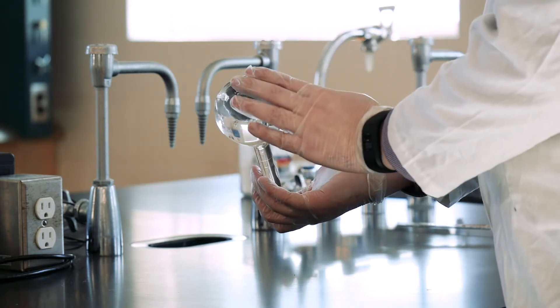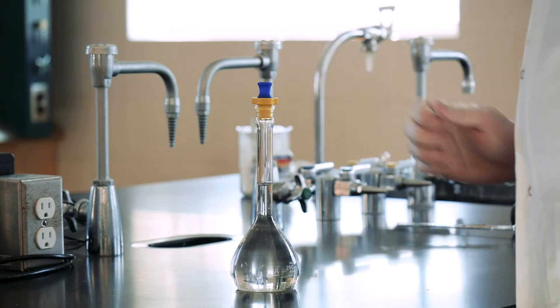This is important because if the solution is not thoroughly mixed, you won't know the concentration accurately.